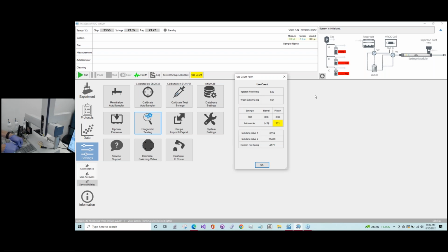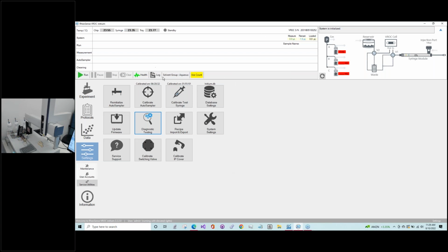Okay, I think what we'll do then is while we're trying to work with this, we're going to switch over to the auto sampler syringe and show you how to manage that, and then we'll come back to the test syringe. So we'll work it out. Okay, so now we'll come back to the test syringe, but we're going to do the auto sampler syringe.